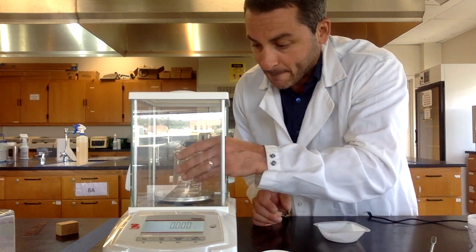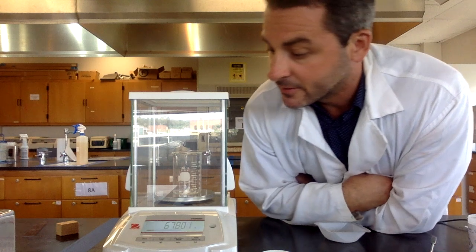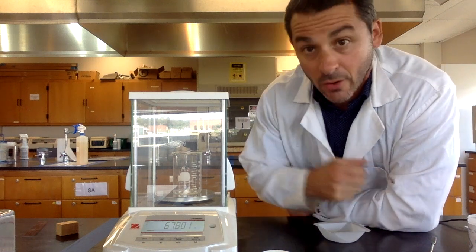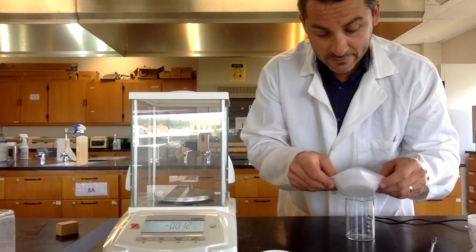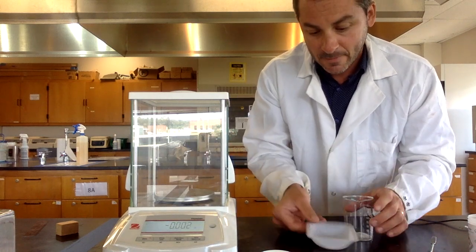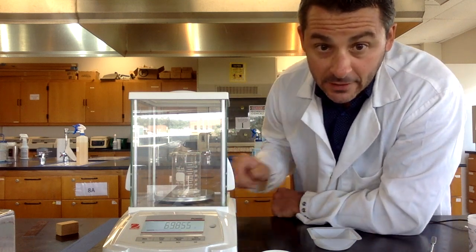Now I'm going to weigh my beaker and I'm going to record the mass, 67.801 grams. Then I put my solid back in there and I re-weigh the beaker with the solid in it, 69.855.